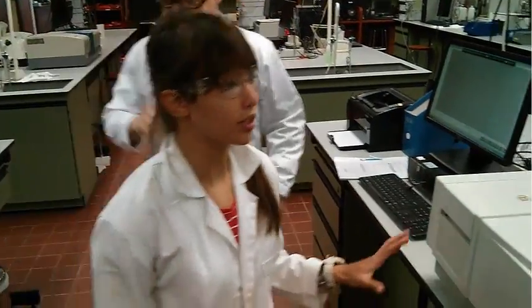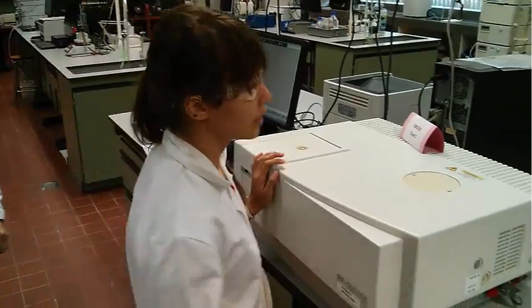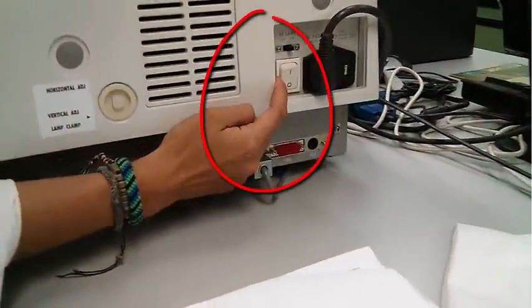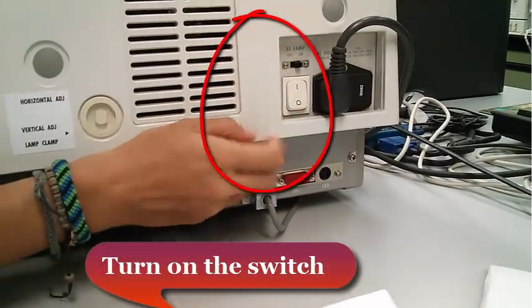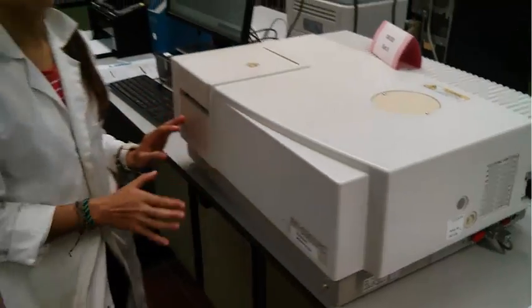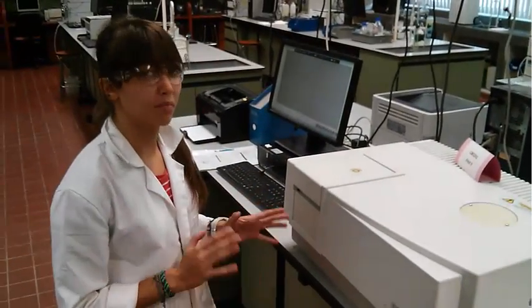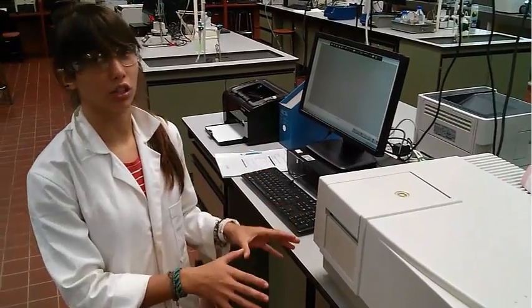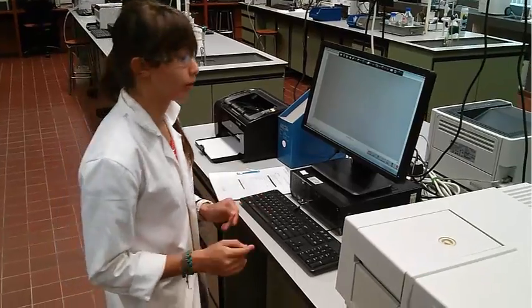Okay, so now we're ready to use the fluorescence machine. We need to make sure it's turned on at the side here. You can see the switch here, you just pop that on. It will take a couple of minutes to warm up. It's a xenon lamp and it will take maybe 10-15 minutes. So if you are the first group and you've just turned it on, give it a little while to warm up. Go and prepare your samples or whatever it is.